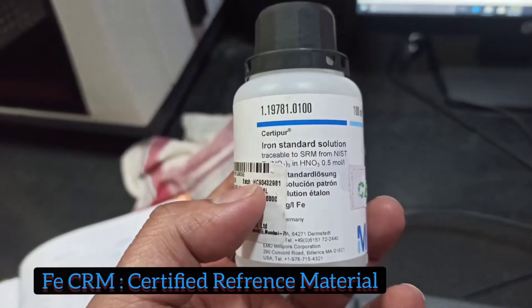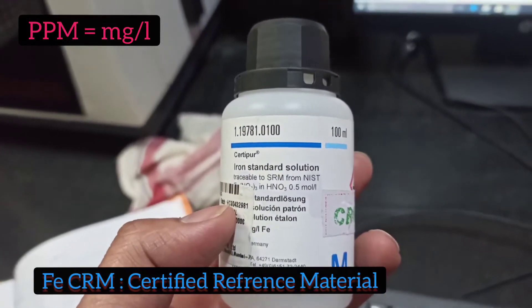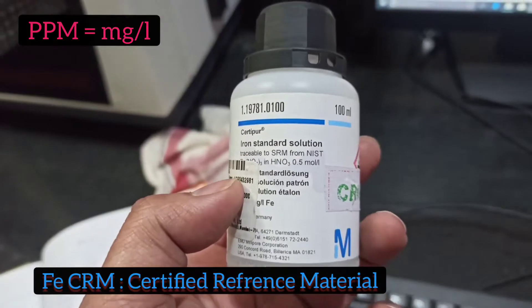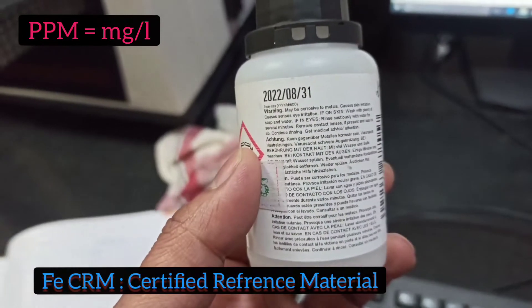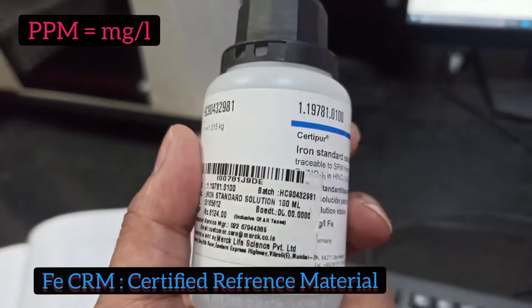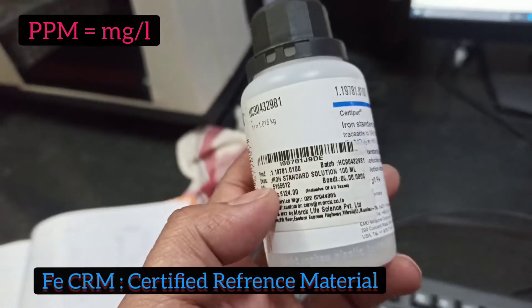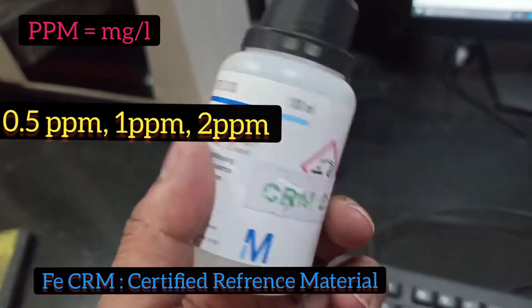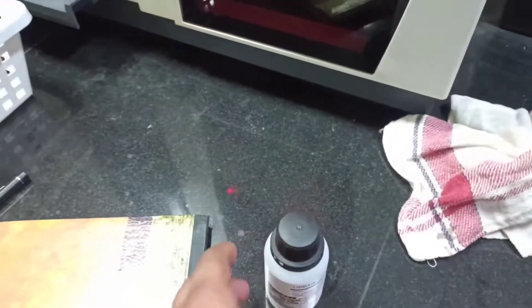Hello friends, today's video is very important — how to prepare different ppm solutions from a standard. You can see this is the iron standard at 1000 ppm. We will make different solutions from this CRM: 0.5, 1, and 2 ppm solutions.